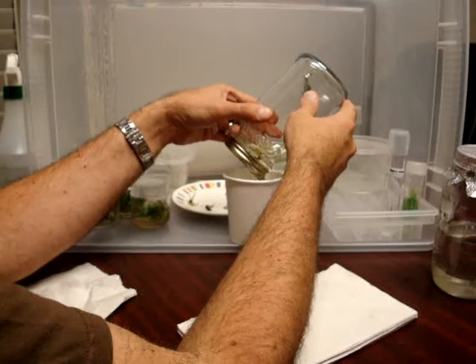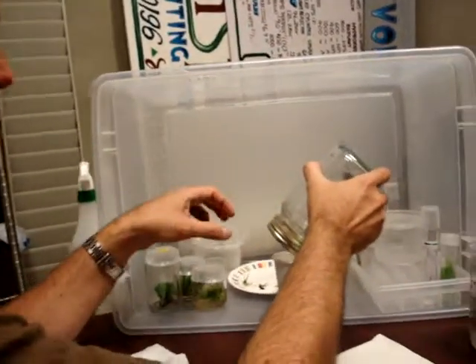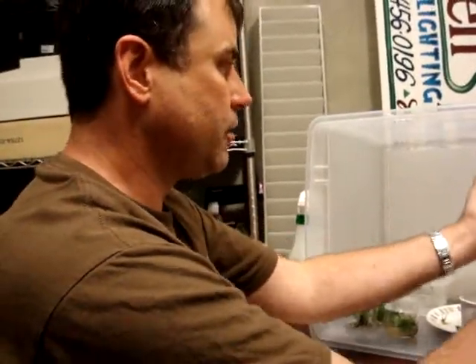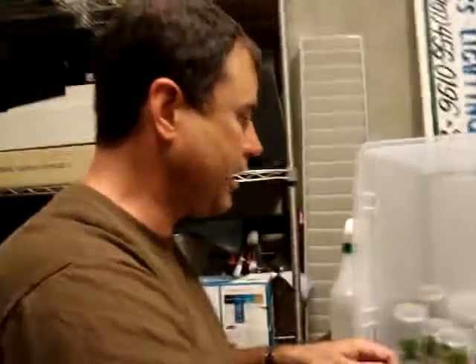This is another thing I shortcutted from the egghead version of this. They used to set three glasses of water, and you would dip each plant into each one — one, two, three, all the way down. And I said, screw that. We're just going to do the whole jar at once. Give me a pause and I'll actually drain that water.